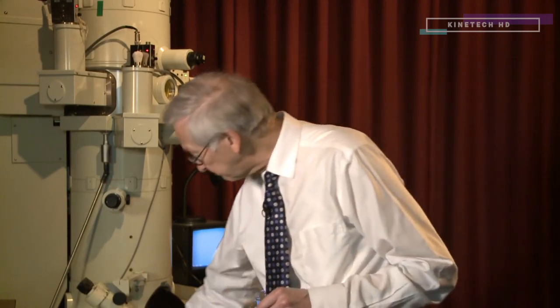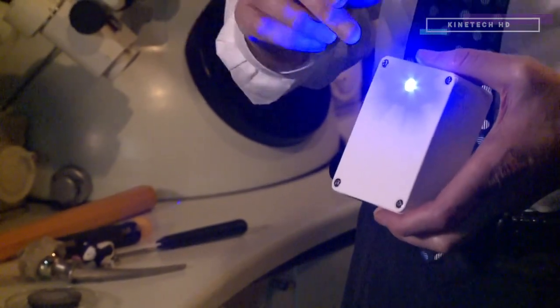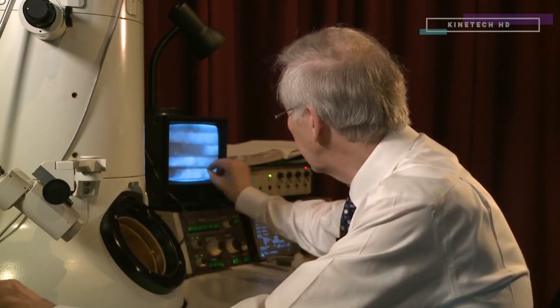This is a blue LED which we grew in the department here. This LED operates because it has very thin structures called quantum wells of material, and these are so thin that 10,000 would sit side by side in the width of a human hair. You can't see these in an optical microscope — you have to have an electron microscope to see them. So to develop these new materials, the electron microscope is absolutely essential. What we're seeing here is an image of an LED chip, and these are the quantum wells which are emitting the light. This is a magnification of 150,000 times. These very thin quantum wells — these dark stripes — are just 10 atoms thick, and it is from this very thin amount of material that the brilliant light comes from our LEDs.